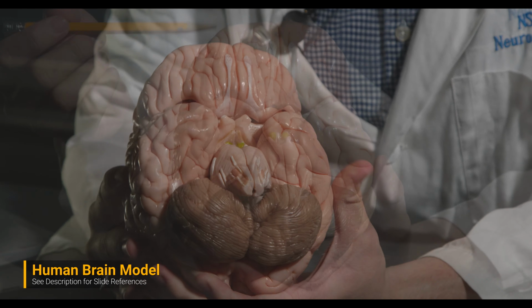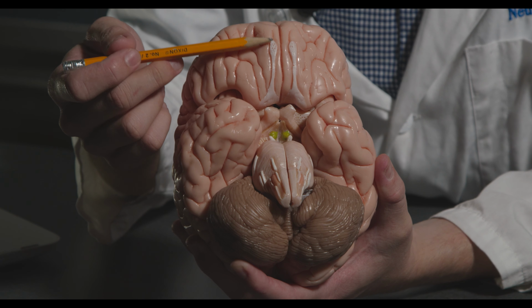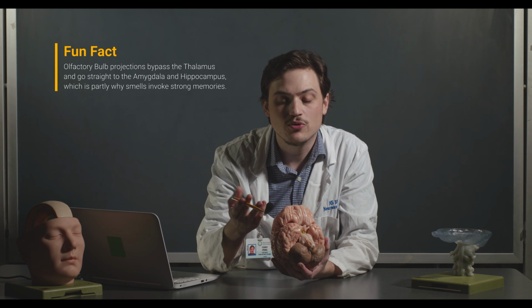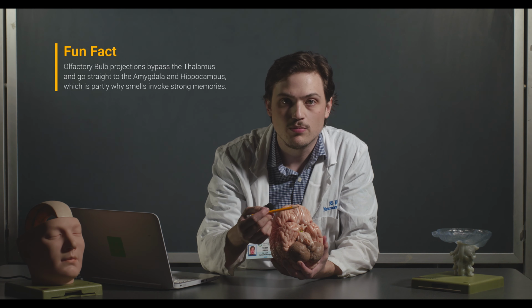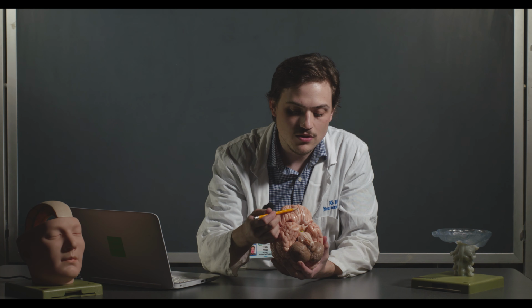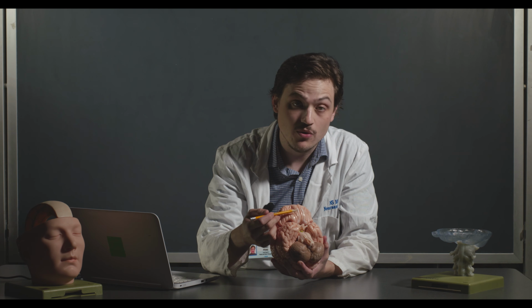Okay. So the first thing that you can see are the olfactory bulbs. Notice how the olfactory bulbs are a lot smaller here than you would see in the sheep brain or a rodent brain, for example. It's kind of interesting that for a lot of mammals, pretty much everything is in the same anatomical region that you see in other mammals. So in the human brain, the olfactory bulbs are positioned in the same area that they are in the rodent cortex. But the rodent really uses their sense of smell a lot, and so the olfactory bulbs are massive compared to the cerebrum. In humans, not so much.